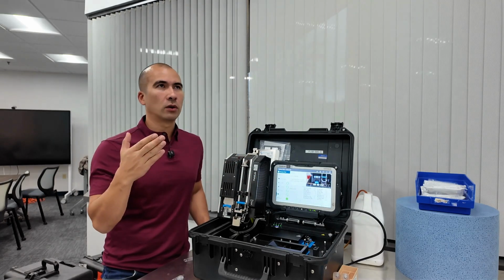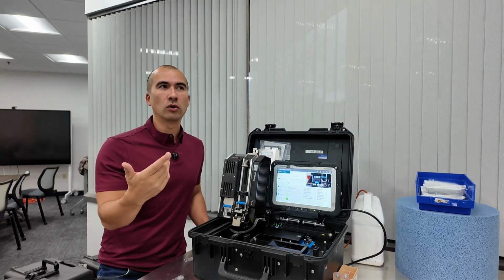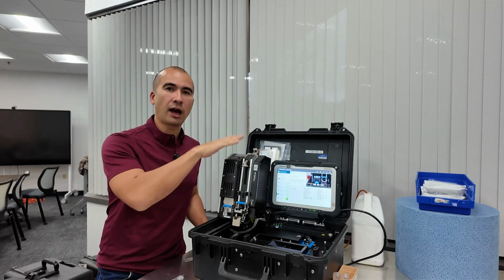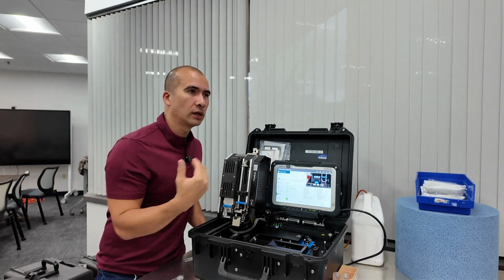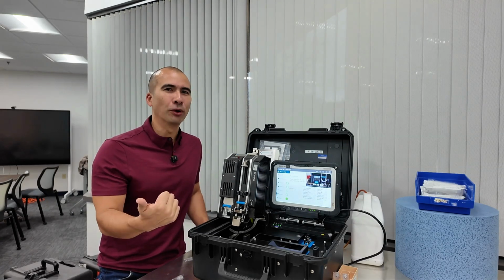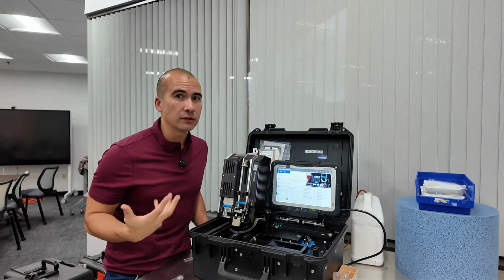As I explained earlier, you are a little limited in that you can only test from about magnesium down on the periodic table. So that ignores the light elements, and boron, lithium, and sodium are probably the only ones of interest in oil analysis that can't be picked up by an XRF. So a relatively small limitation. And when it comes to wear metals, almost completely irrelevant, right? There is nothing in the wear metals that I can think of that is made from boron, sodium, or lithium. So when we're testing wear metals, there's really no downside to using XRF.